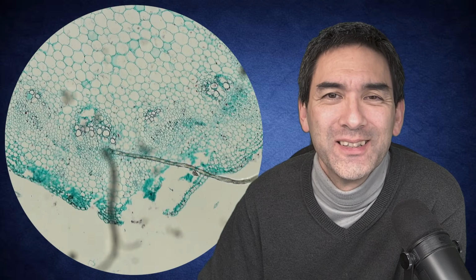Using my 10 times objective now, it looks quite okay at first sight. However, if you scan the slide a little bit more, you're going to notice, look at this. This is some dirt in here, some dust fibers, and over here where there is no specimen, all of those little dots that you see here are dust and dirt. But overall, it looks a little bit torn also on the side here.